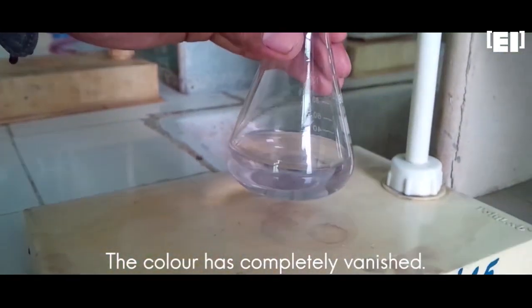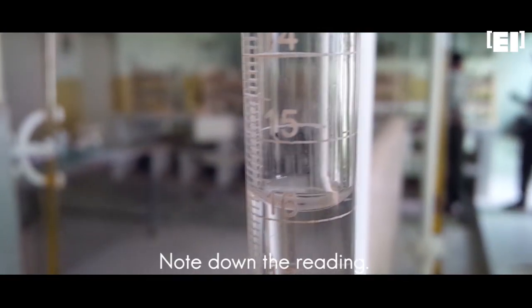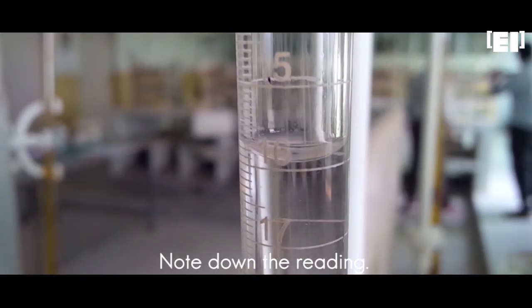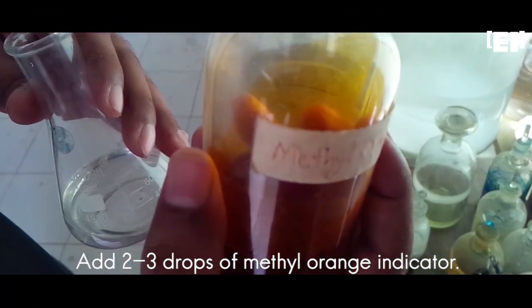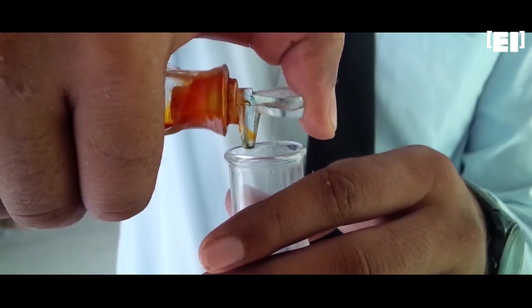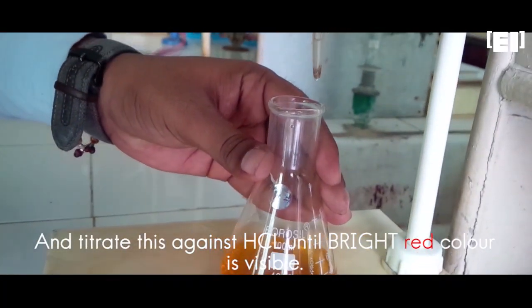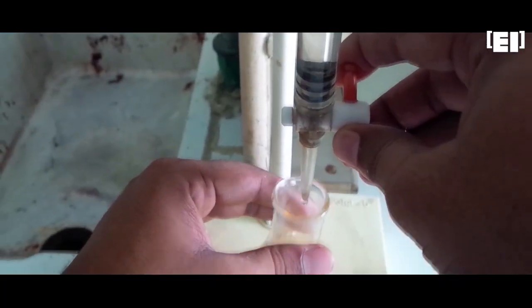The color has gone. Note down the reading from the burette scale. Okay, now add 2-3 drops of methyl orange into this solution. And titrate the solution against HCl until bright red color is visible.